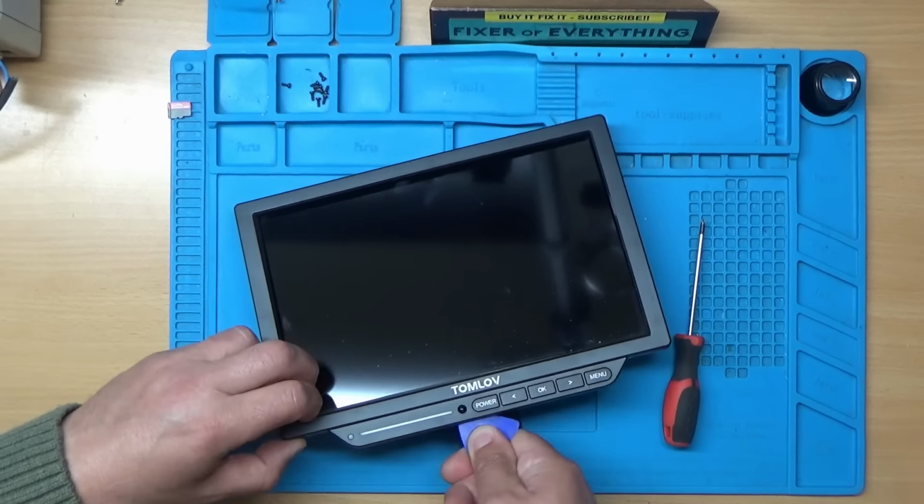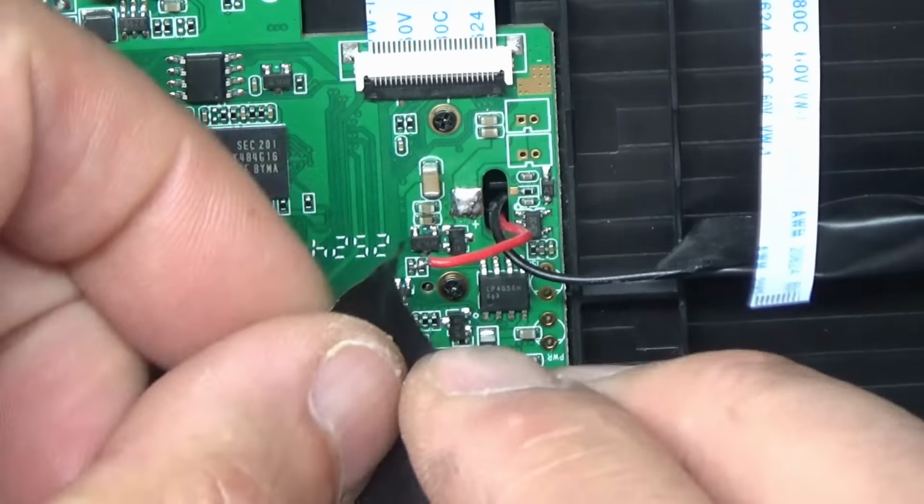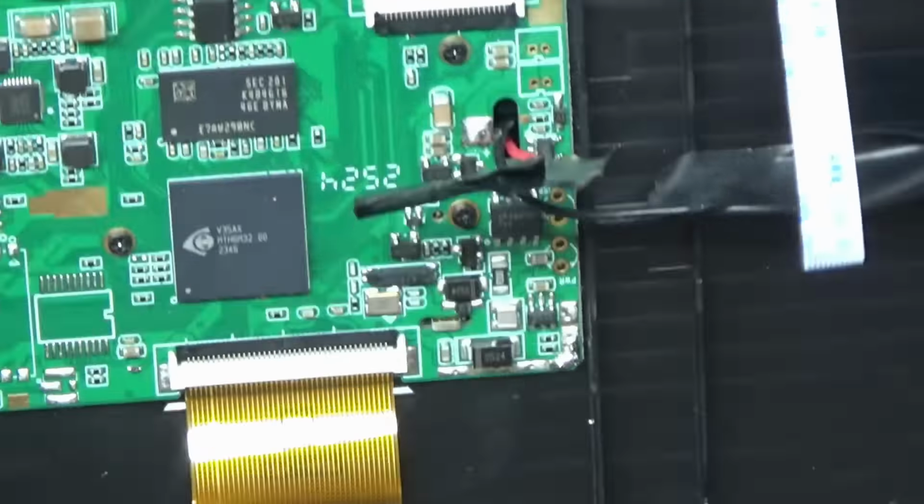So what I might do first then is just desolder this wire here. We'll put a bit of tape around it so we're not going to short anything out. So I'll just plug the iron on. I'll just grab a bit of tape to put around that. And now I can safely desolder the positive wire. Oh, that must be the cable that goes to the board at the back that we actually need to replace.